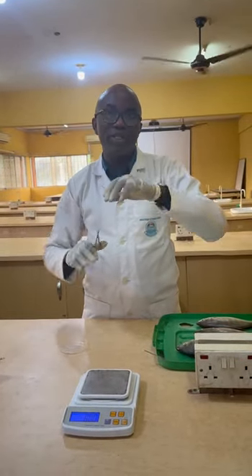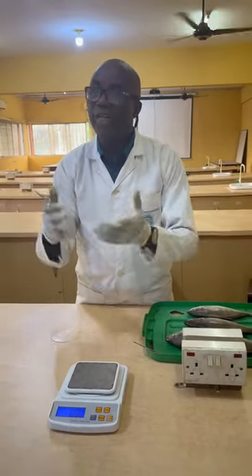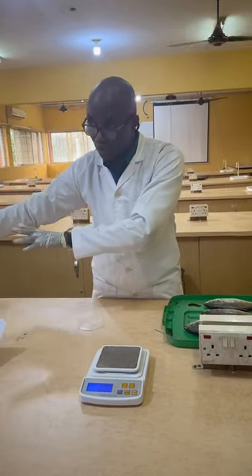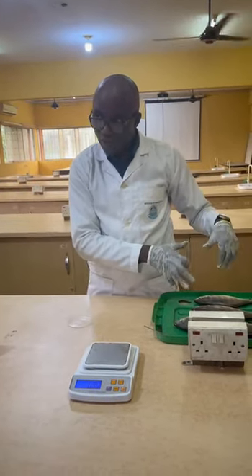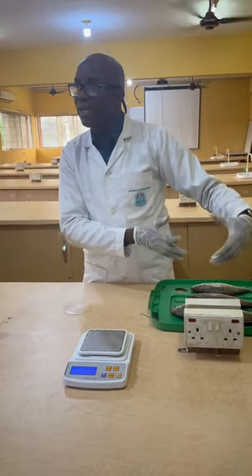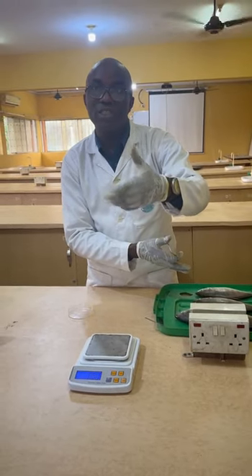The specimen, we already did the length and weight measurement. So what we want to do now is to check for the sex. There's some fish species that you can easily identify the sex without even opening up the fish. Examples are the catfishes, like Clarias gariepinus, and also Chrysichthys. Clarias gariepinus is what? It's a freshwater species. But since we are just working with these ones, which are marine or brackish water species, if we have Chrysichthys nigrodigitatus, that is silver catfish. It's a brackish water species.